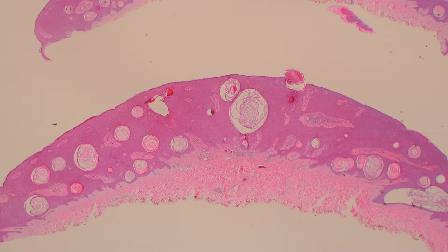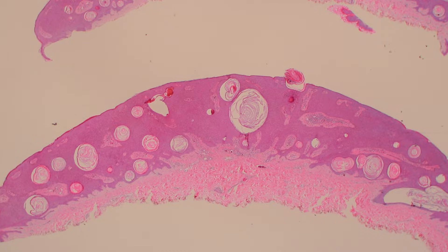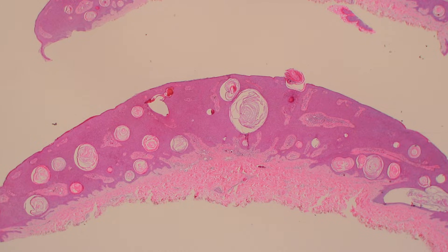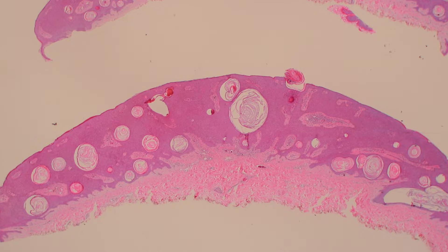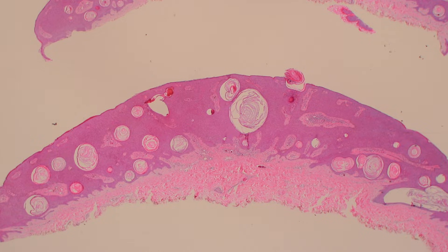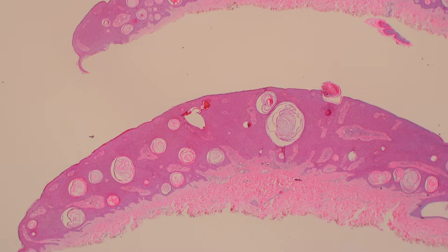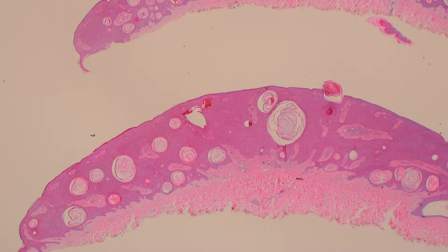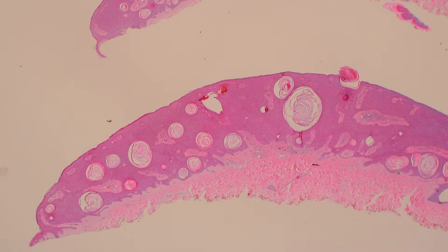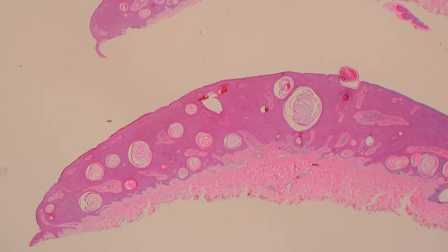Here's a seborrheic keratosis — I've got a video about seborrheic keratosis and another video about squamous cell carcinoma with a lot more details, I'll put that in the video description. Seborrheic keratosis is an acanthotic lesion made of keratinocytes. It tends to have a flat border and it's pushed up above the epidermis.